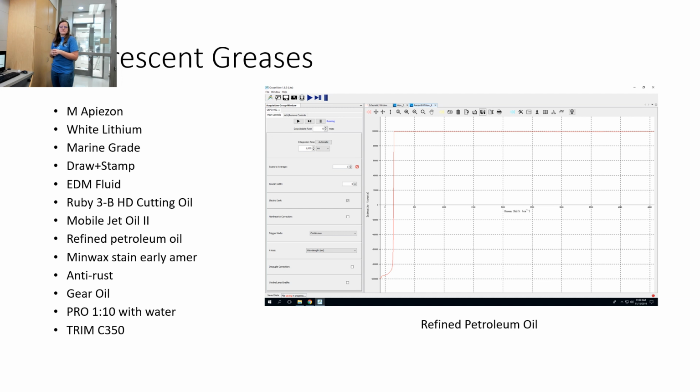Why does it start so far below 0? I don't exactly know, except that it looks like it's been normalized to some degree. That's a question I have as well. I don't know why it's going from negative 80,000. It did that on all of them. It's probably just because the detector is so saturated, but I don't know why that would push that signal down. I didn't put the trim C350 up on here, but I want to say that was about half fluorescent.